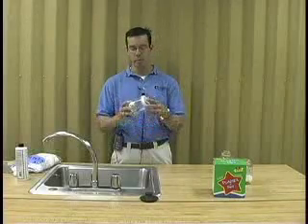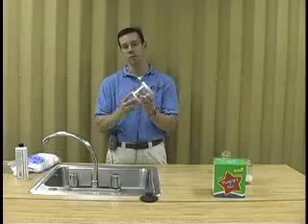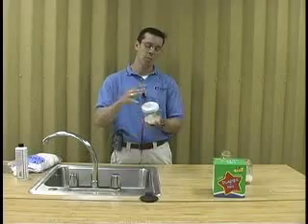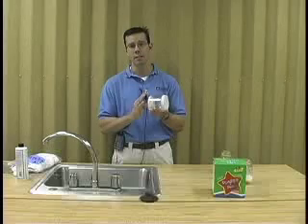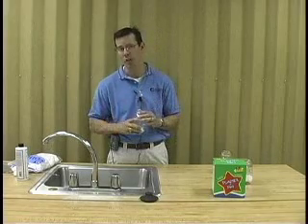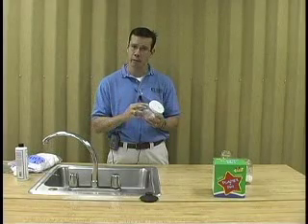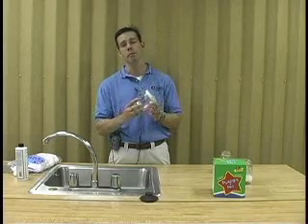Two other points to remember when dealing with a kill jar: take duct tape or masking tape and tape the bottom of the jar. The reason you want to do that is because if you're in the field collecting insects and putting them in here, if you happen to drop the jar, it's not going to break that way. That's just for your own protection. The second thing you want to do is make sure you label this a kill jar and put on there poison, acetone or ethyl acetate, which is another compound that can be used as a killing agent. But remember to always label your vial or container as poison, and to remember to tape the bottom for your own protection.